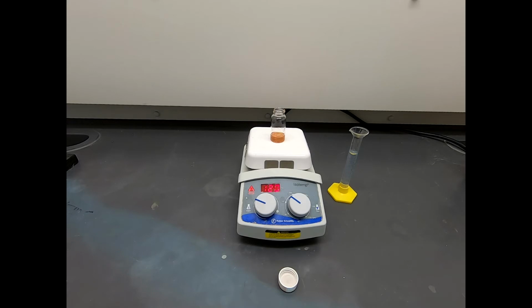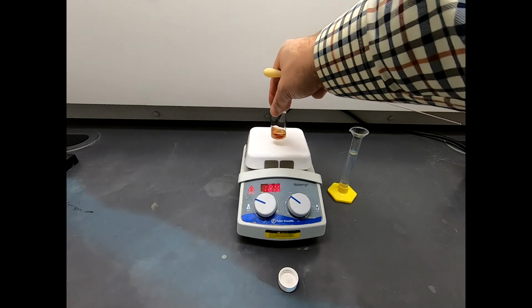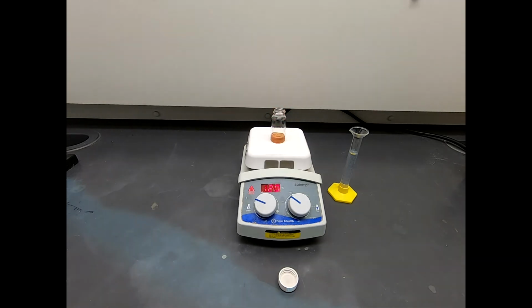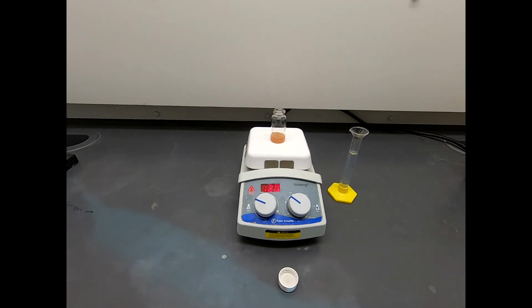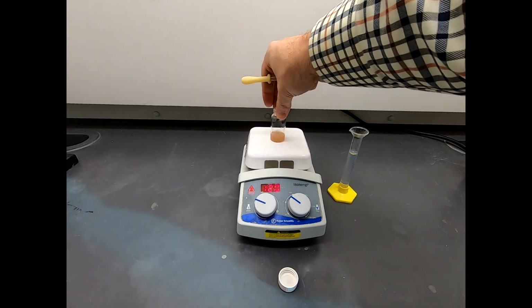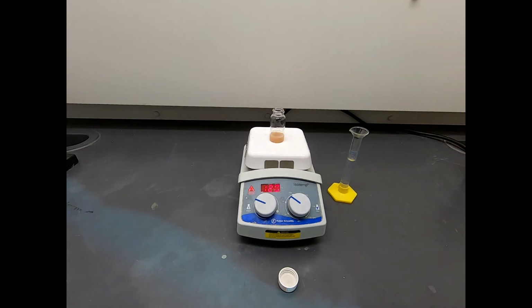Okay, that TLC plate looks really nice, so we're ready to stop this reaction. Note that everything is still dissolved. In fact, it's still hot on the hot plate, and while it's still hot, I'm going to add some water to this. The water is going to increase the polarity of our solvent. Our product is going to precipitate out, and you can see it's actually starting to precipitate out before our eyes. So let's go ahead and add the water before it happens too quickly.